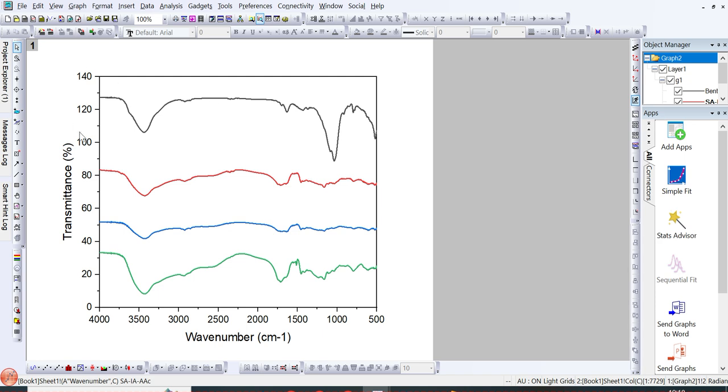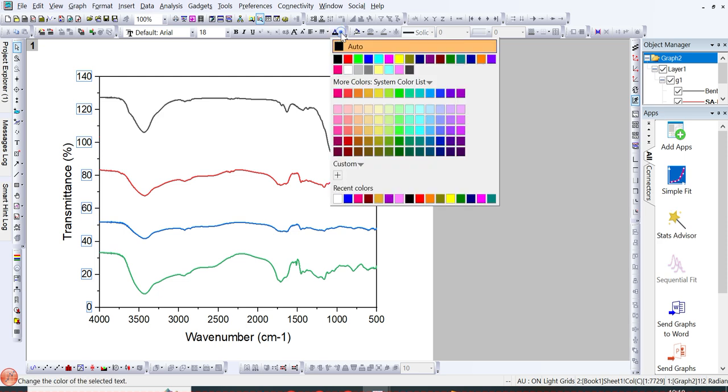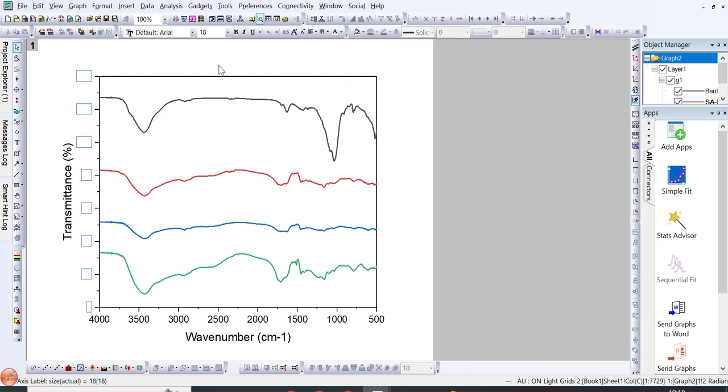So if you want to remove this axis data, then you can just click on this, and then you need to go to here, and you can simply make its writing white, so it will disappear like this. In ACS or Chinese papers, you can see the images and spectra in this form.